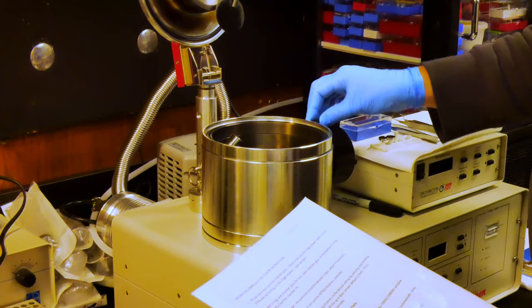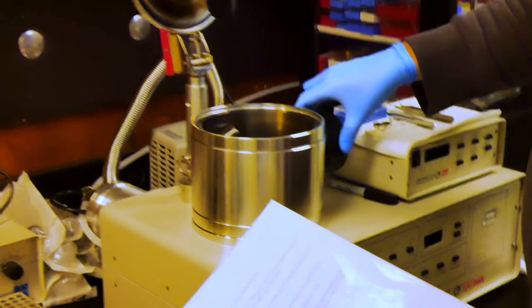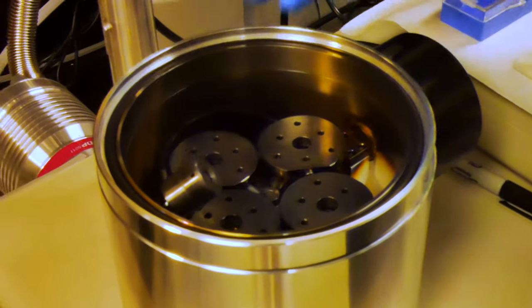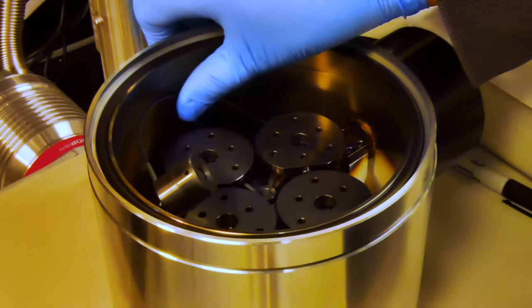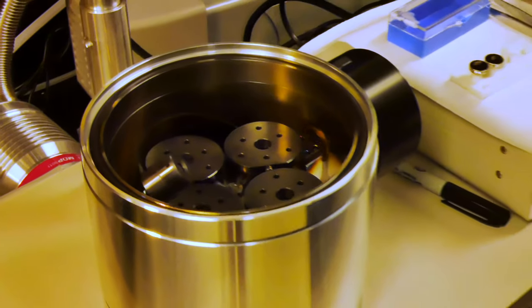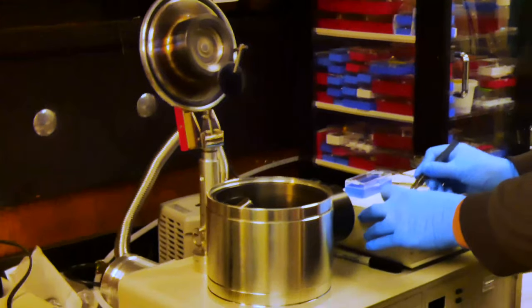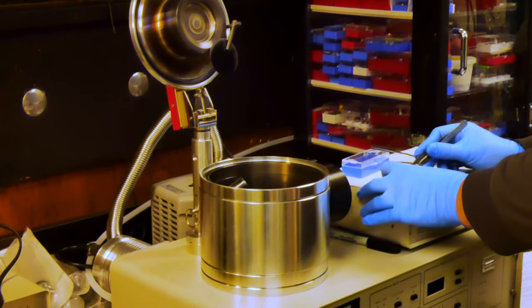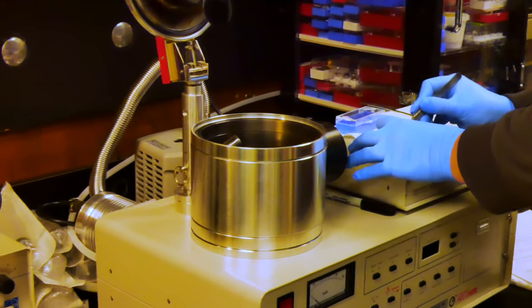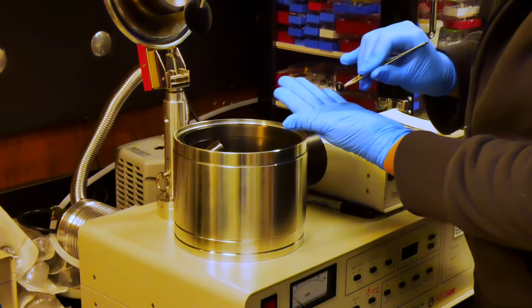I will change the angle of the stage by moving this lever and then twisting to bring it to a level plane. In the process, I will tighten that down again. I'm just going to move the cable out of the way so that it's not catching any of the samples. You want to make sure that your samples are secure. Since they are on this carbon tab, while they may be decently secure, you don't want to shake them because you probably could shake them off. So we'll do just a gentle tilt.